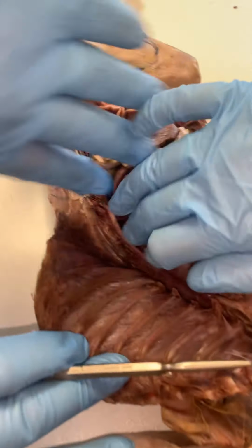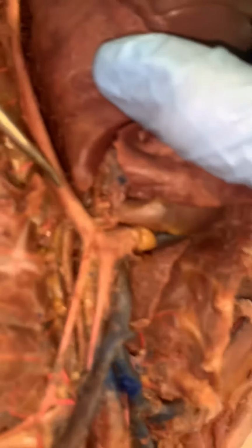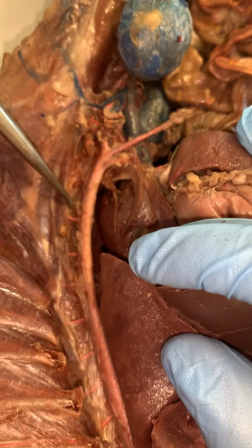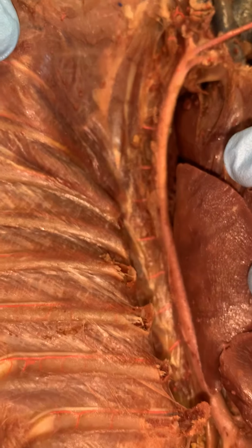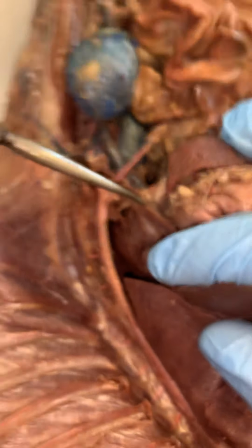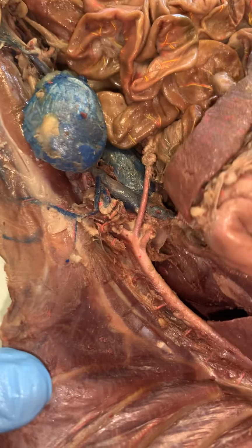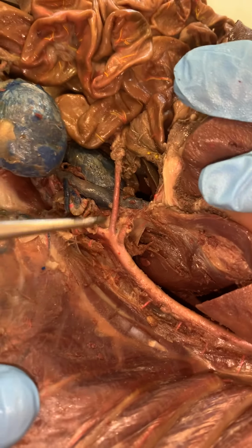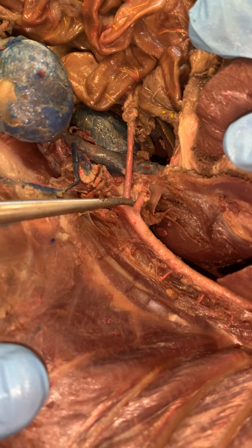All right, Jen, pull that out of the way. So there's my descending aorta, or the thoracic aorta, coming down. These little branches coming off here are the intercostals that we can see coming right along and through here. Now, I've got a remnant of the diaphragm that's left right there. As this passes through the diaphragm, there are three unpaired arteries that come off. The first one is this one right here. We can just see this little piece of it. This is called the celiac trunk.